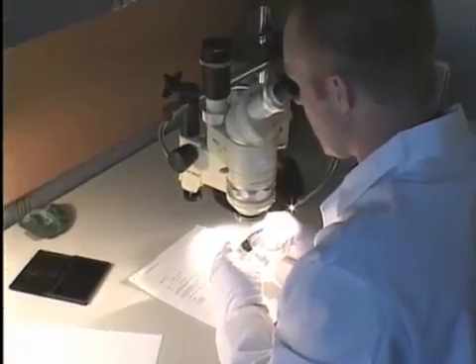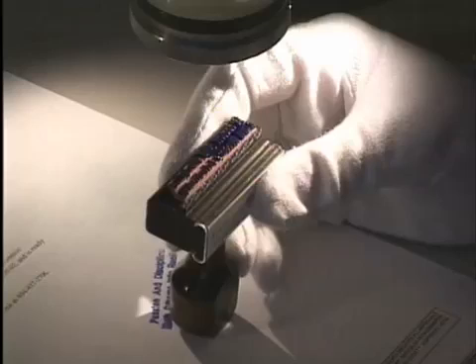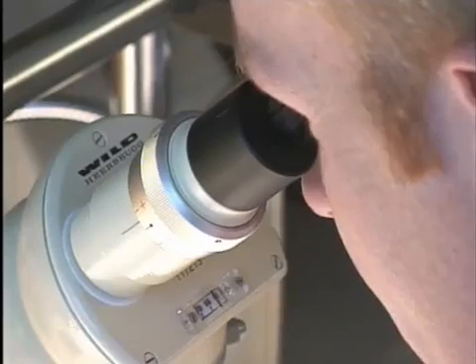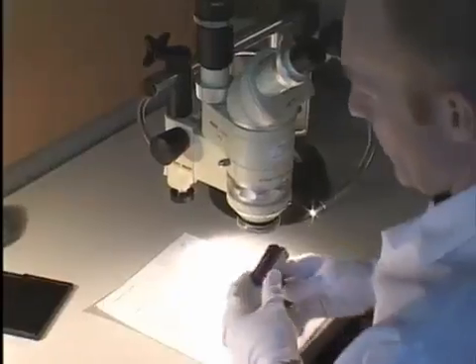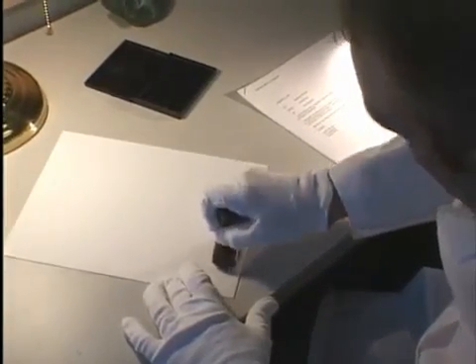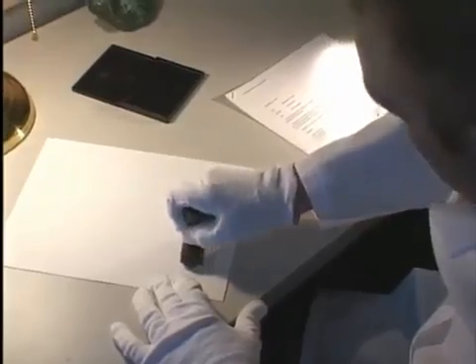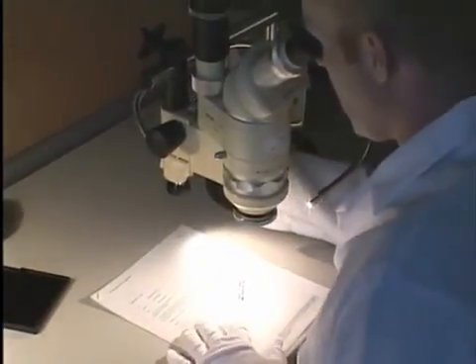All manufactured mechanical devices contain microscopic irregularities such as dents, pits, or scars. Using a stereo microscope, the examiner locates the unique markings on a mechanical device such as a typewriter, check protector, notary seal, or rubber stamp. When the unique markings on the device match impressions of those markings on a question document, a key piece of evidence is established to help the law enforcement investigator build the case.